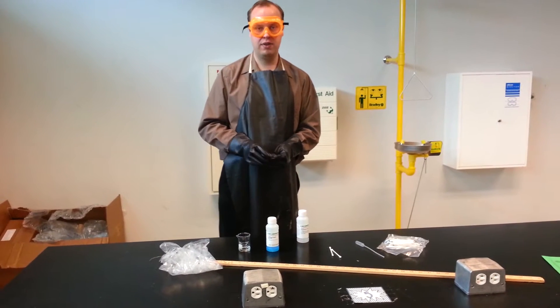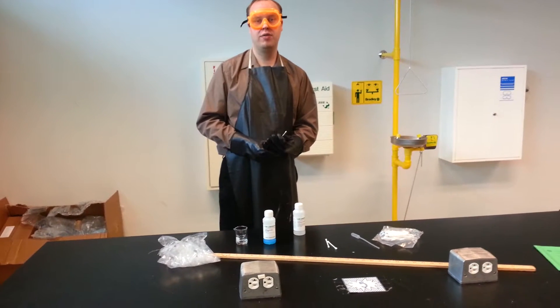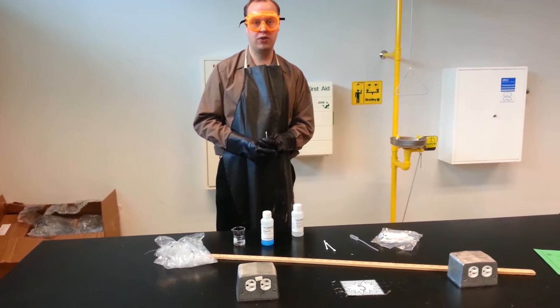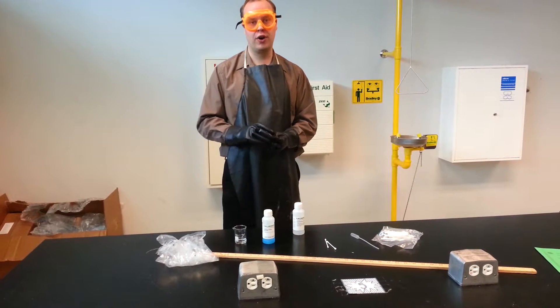We are going to see the test of nitrates. This is the same test that a lot of forensic scientists will use to determine if there's gunpowder in a crime scene.